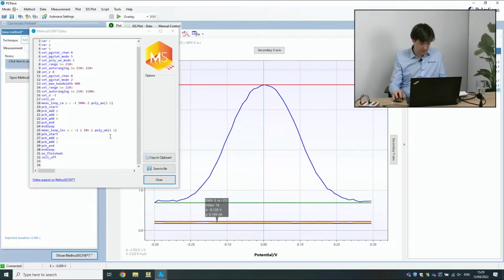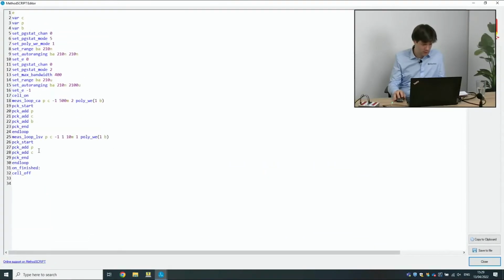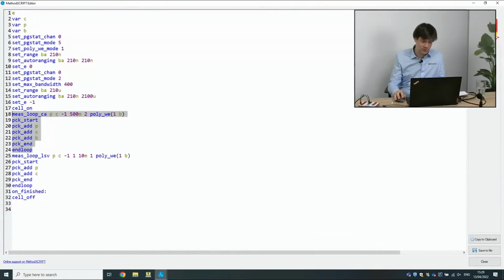You can see here that it's already generated a script with 2 measurements in it. It's using a chronoamperometry measurement as the equilibration time of 2 seconds. And right after that comes the LSV. So that's intended. That's one of the main features of the script. So that you can chain measurements.